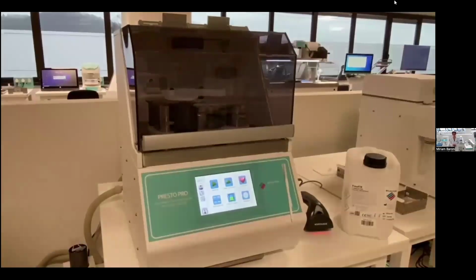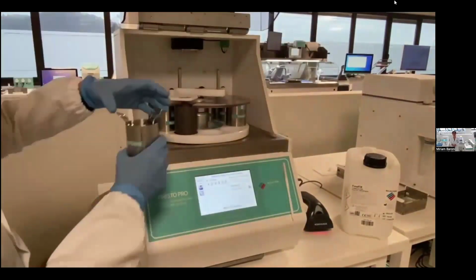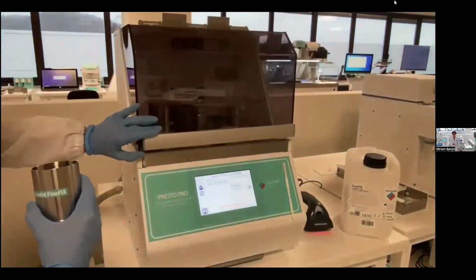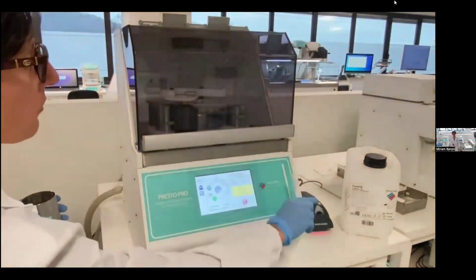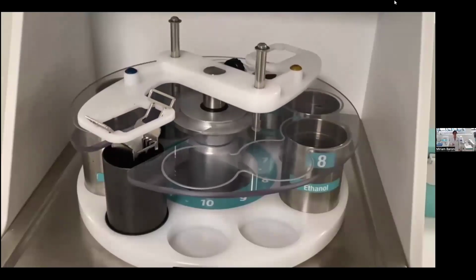Presto Pro is an automatic processor and stainer for frozen sections that is very easy to use. All I have to do is to start the program in the device, open the cover and place the rack containing my section on the arm positioning tool, close the cover and start the program. Now let's see inside the cavity. As you can see, the arm can move my section through the different staining steps.